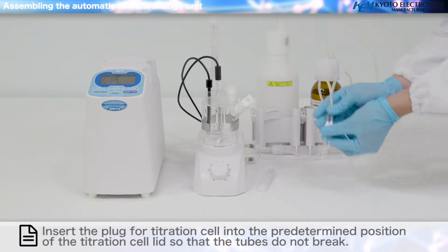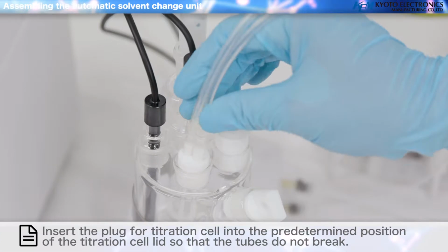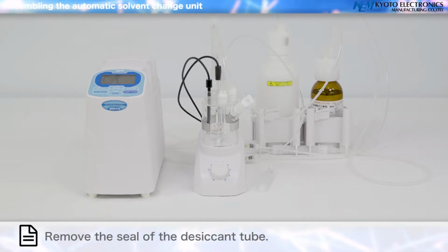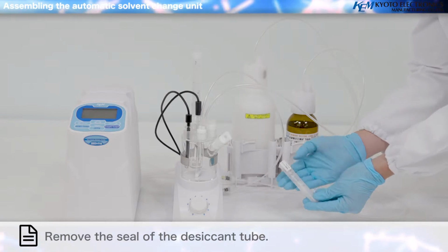Insert the plug for titration cell into the predetermined position of the titration cell lid so that the tubes do not break. Port plug and the syringe inlet. Remove the seal of the desiccant tube.